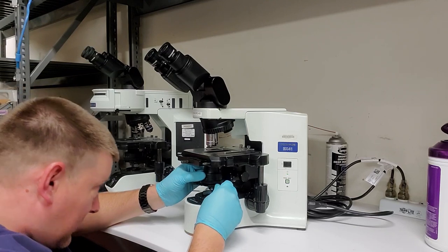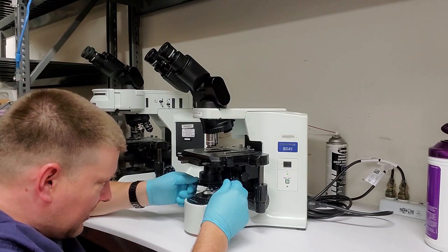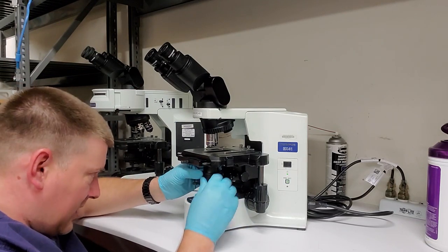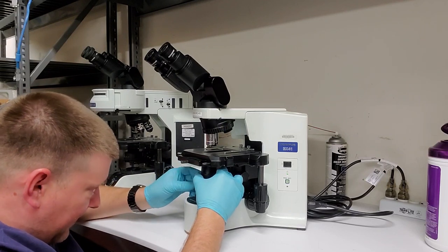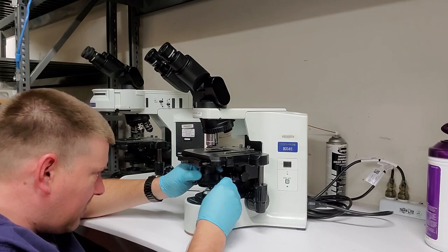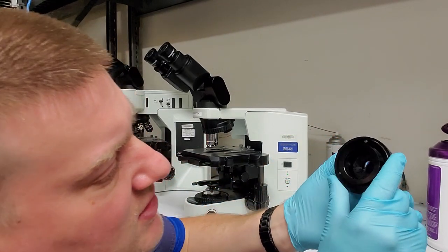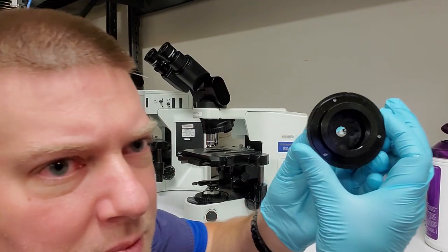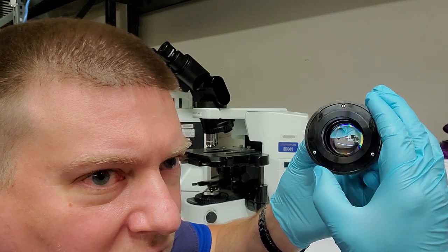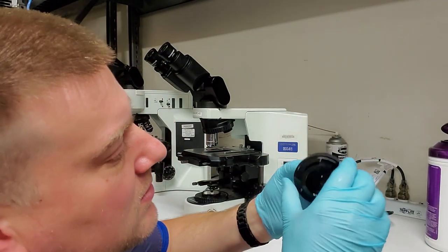Now this guy right here, you got to be very careful. There's set screws that are holding it in. So I'm going to loosen up all the screws. There is a V groove, and it should slide right out. There we go. So this is what the condenser looks like. All right, you can see the aperture on the inside. See that? See all the leaves to the aperture, how they open and close, just like the iris of the eye.